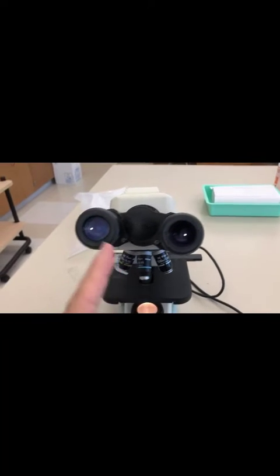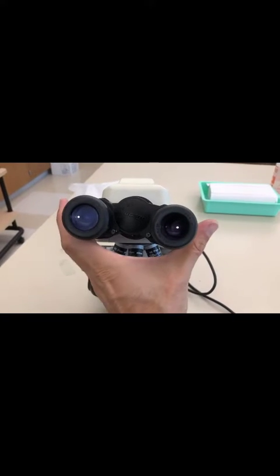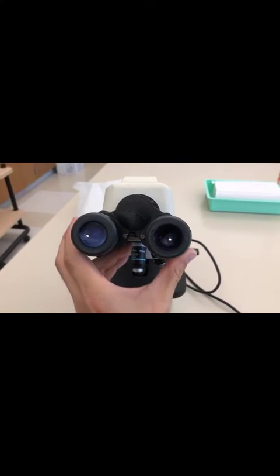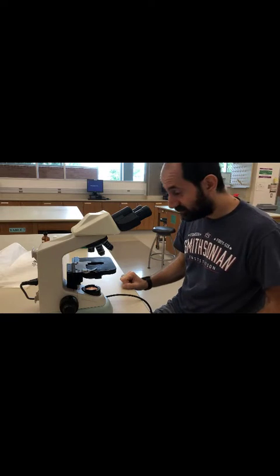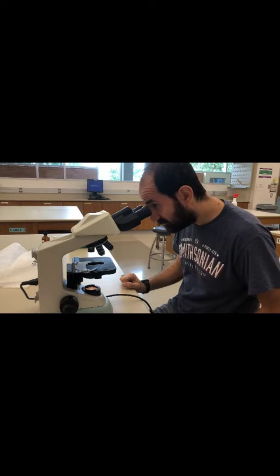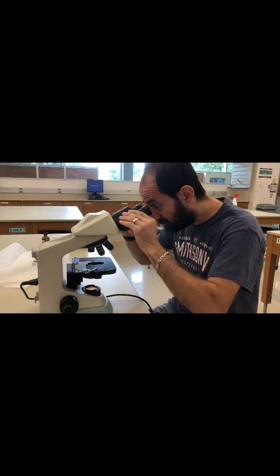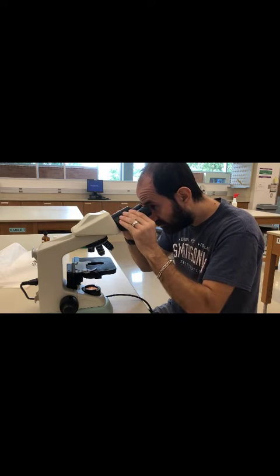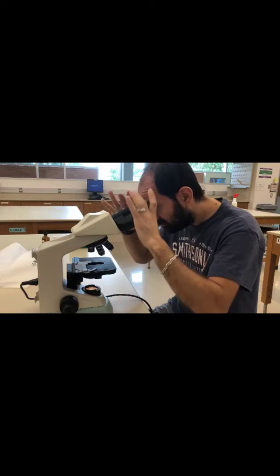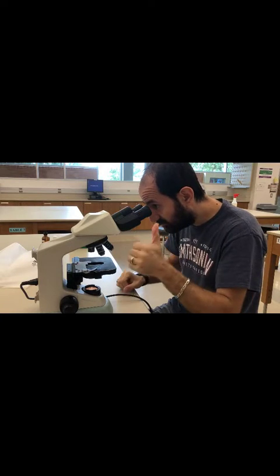You want these to line up with your eyes, so you can squeeze them or push them apart so that they actually line up with your eyes. I'm trying to get them to line up with my eyes. Much like you would a binocular, you'll adjust this and you should see a round field of view.